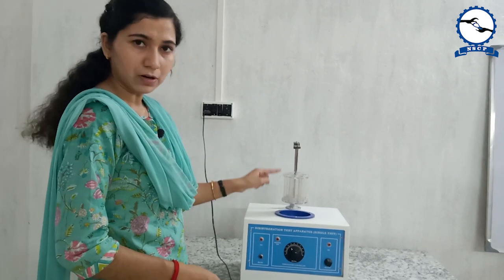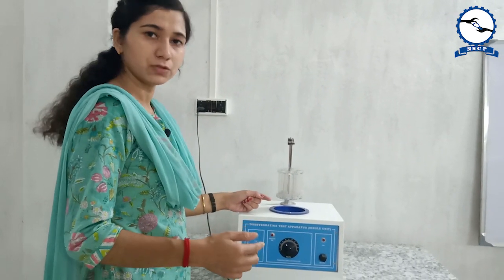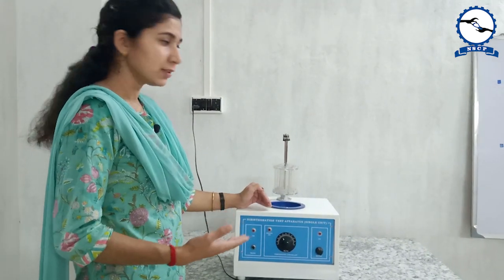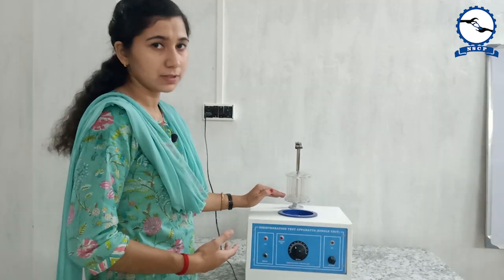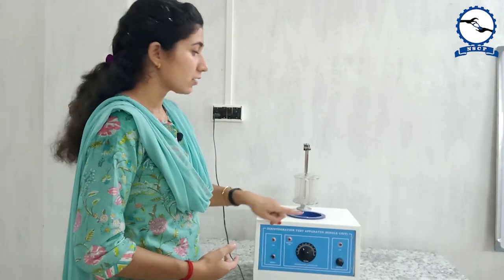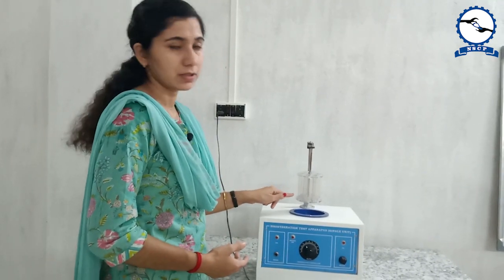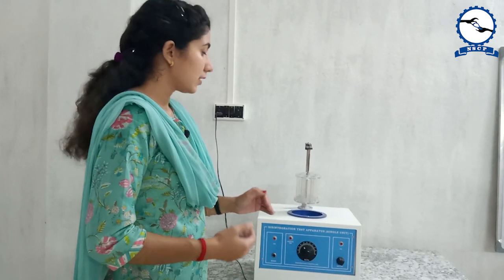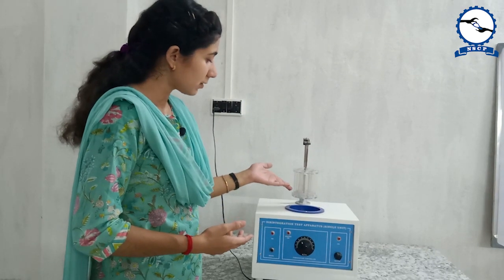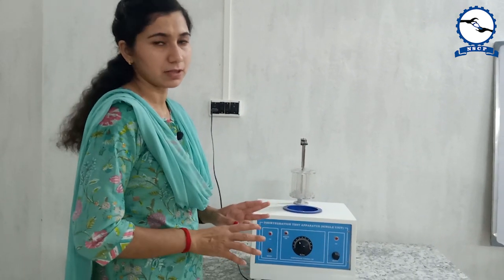It goes up and down because it mimics the peristaltic movement of our stomach. When the disintegration test is done, all the contents of the tablet will be transferred into the beaker placed here. No residue should remain in the tubes — only then will the disintegration test be passed. If tablet residues remain, it will fail the disintegration test.